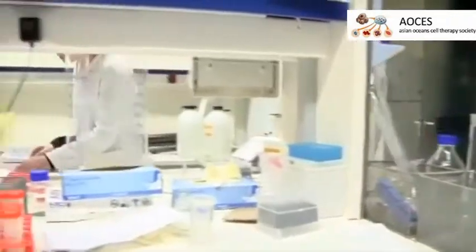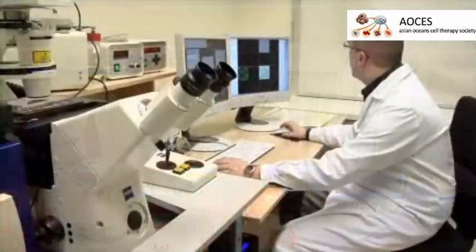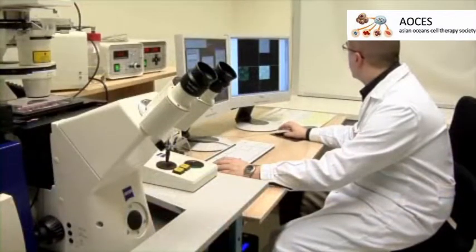Our design criteria were a fully in vitro system where only the host and the donor cells are present, so it is isolated from the surrounding tissue. Continuous measurement of cell viability before, during and after the injury for up to 24 hours. And clear identification of both cell populations so the fate of the grafted cells can be traced.